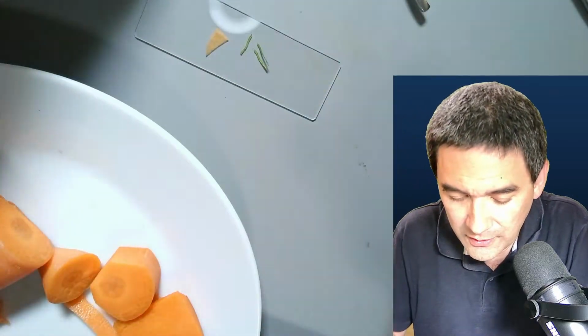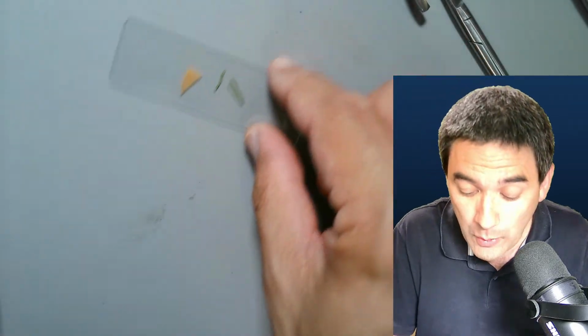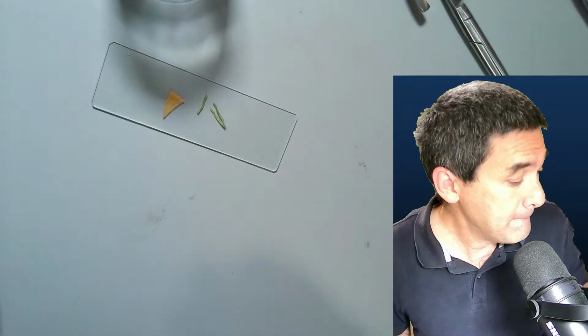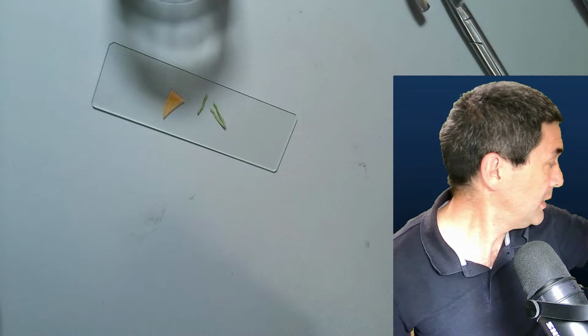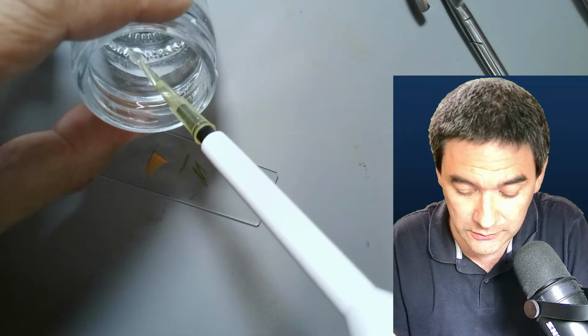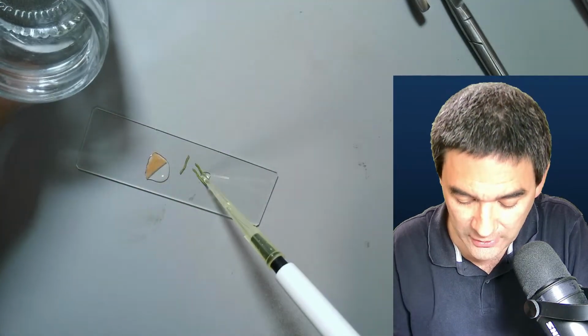Again, with those commercial big rotating microtomes and with the sample properly embedded in paraffin wax and so on, of course it's an entirely different issue. Okay, but I'm going to show this to you now, and in my mess that I have here, I don't even know where I put my pipette. Here it is. Okay, here we go. And I'm just going to add a little bit of water, because those specimens like to dry out quickly.